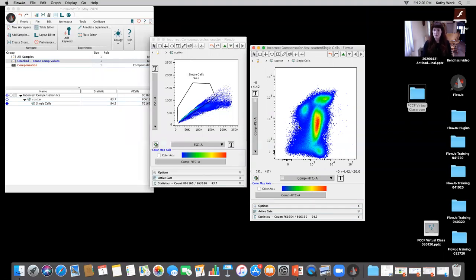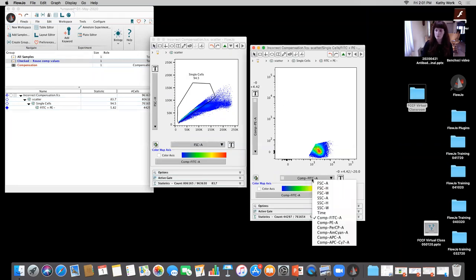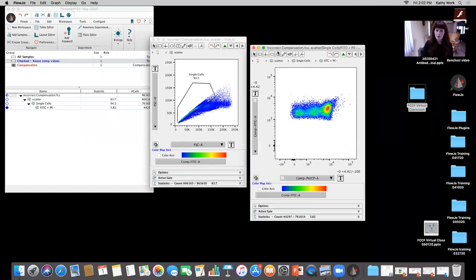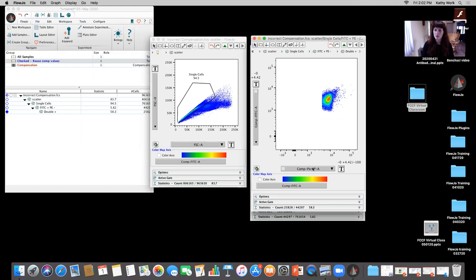So right now, things aren't looking absolutely the best, but it's really not looking bad. Okay, so again, just referencing my little gating strategy here, they wanted FITC positive, PE negative, making a little bit of a guess there. I have that right there. And then they had PerCP versus FITC, and they wanted the double positive there. Again, I'm not going based off of control here. I just want to show you the reason why this is so important.